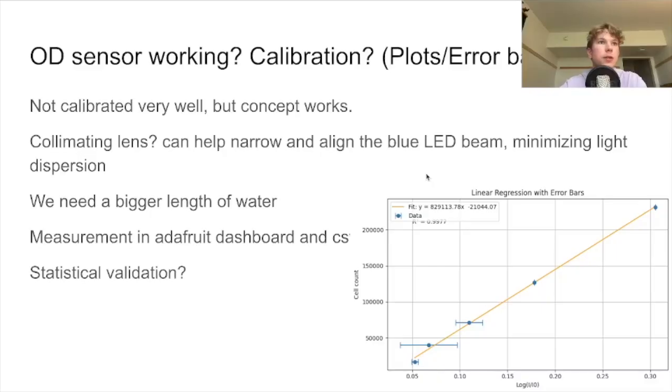So the concept of the OD sensor works, however calibration is a bit off and reaching the low concentrations remains a bit difficult. So far we've seen a cutoff detection value of around 16,000 cells per milliliter, where the tested values of 8,000 and 4,000 and 2,000 can't really be told apart. We could use a larger length of water from LED to sensor to create a high sensitivity for the lower concentrations. Problems with the relay frying meant we had no time to do the planned final OD calibration. And our plot can be seen here with our error bars.